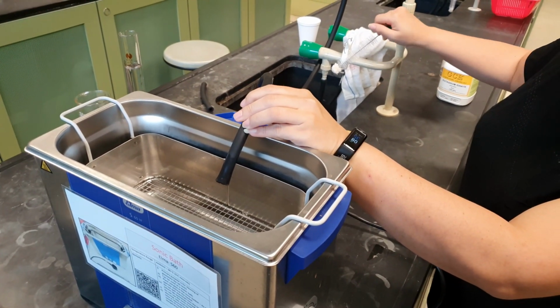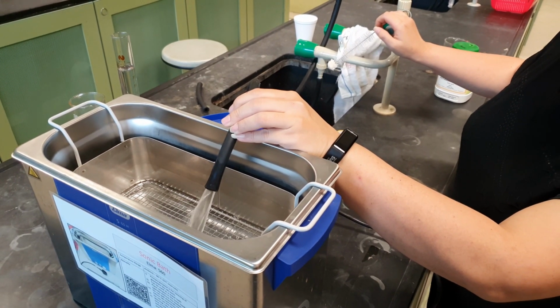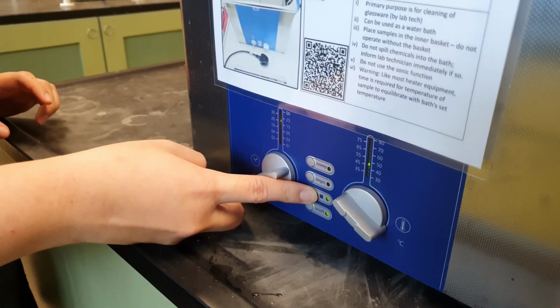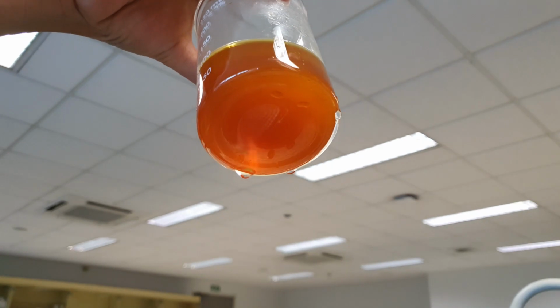First, fill a sonicator to the line indicated on the machine with water. Next, put in your sample and switch on the sonicator. After a few minutes, switch off the machines and take out your sample. Check that all the solids are dissolved.